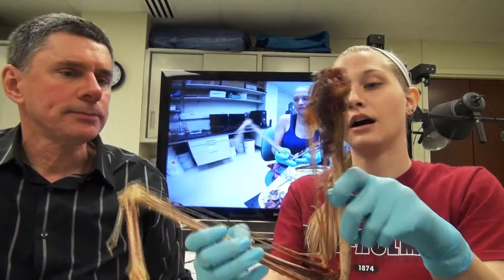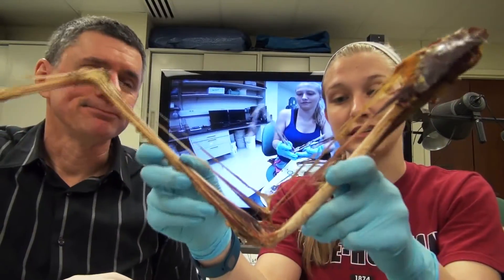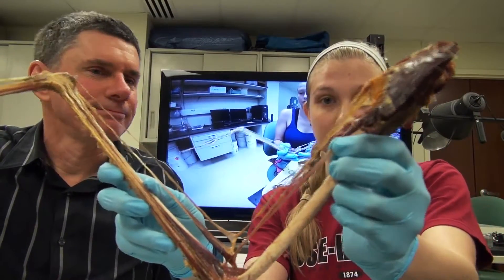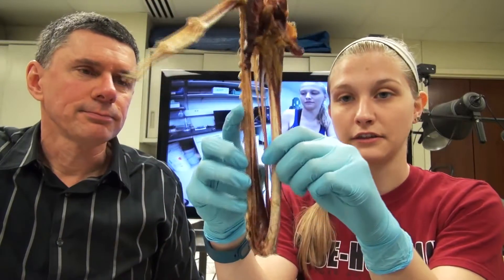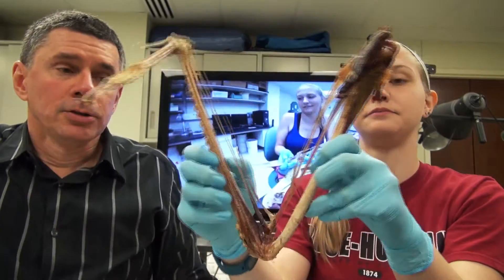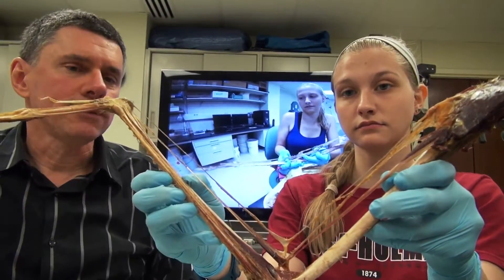That idea might work pretty well for a pigeon which has a pretty heavily muscled set of wing bones. But how did that hypothesis play out for our albatross? It turns out not very well. We removed zero muscle from this arm and as you can see it's really lightly muscled. This is actually a bicep right here so it's a tiny muscle. And so when you actually bring the two bones together, there's no muscle down here to collide and displace the radius.